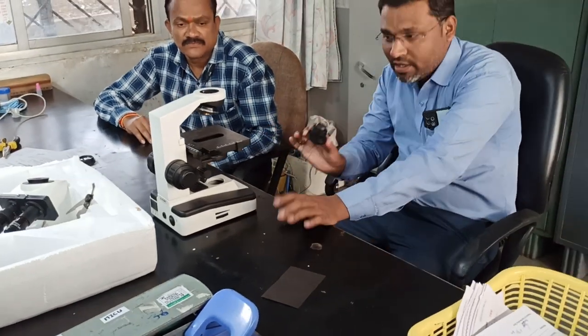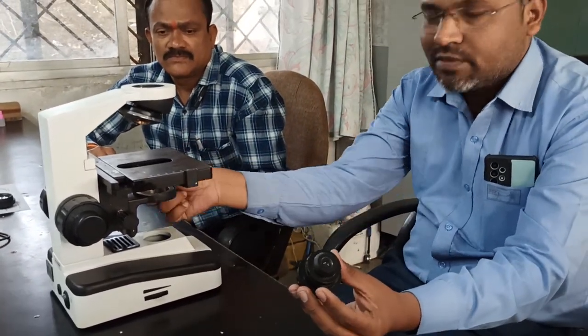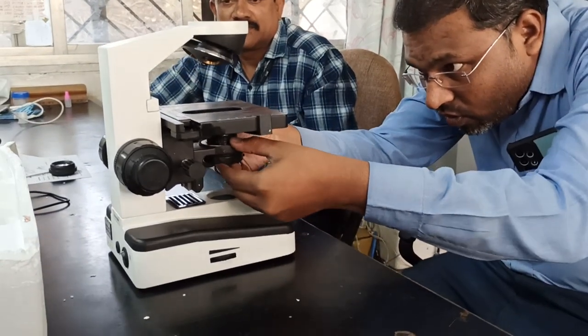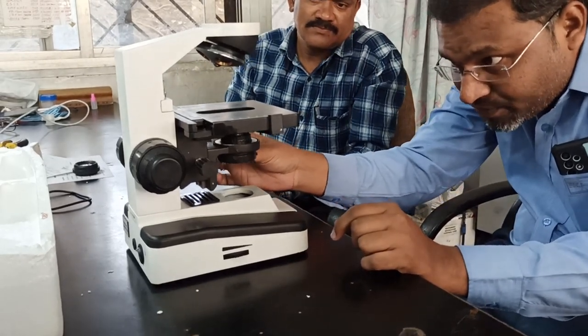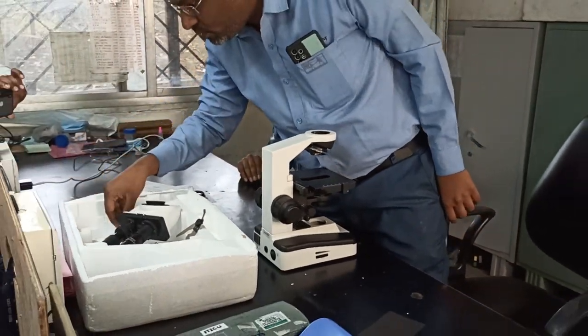How to install it? Simply come close. You just have to ensure that it is on the right side, so it is easy and convenient to adjust. So you just fix it like this. Okay, we have fixed it properly and it is easily accessible, right? There is one Allen key provided with this condenser. This is the Allen key which is provided with this one.